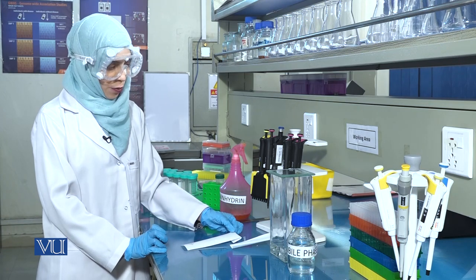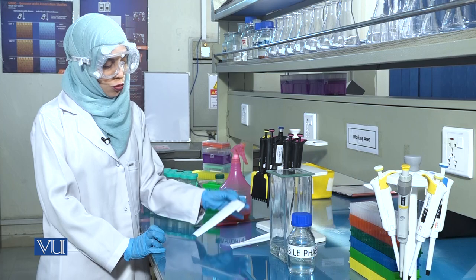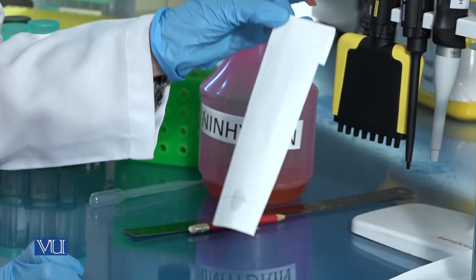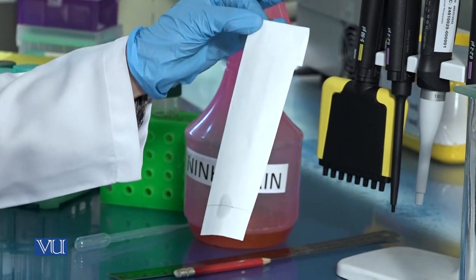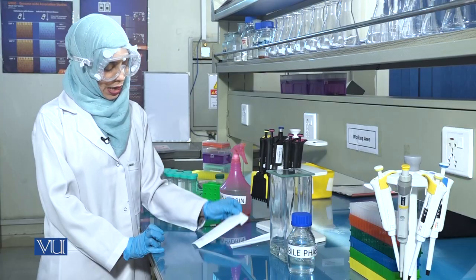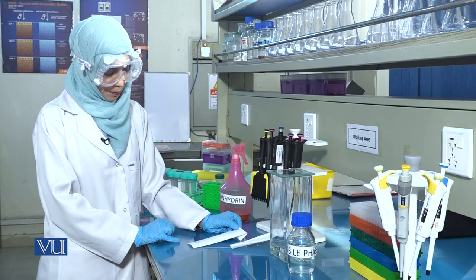During any point of this experiment, do not touch the filter paper with bare hands, since skin secretions also contain compounds that will react with ninhydrin and give us false positive results. Allow the sample to air dry completely.